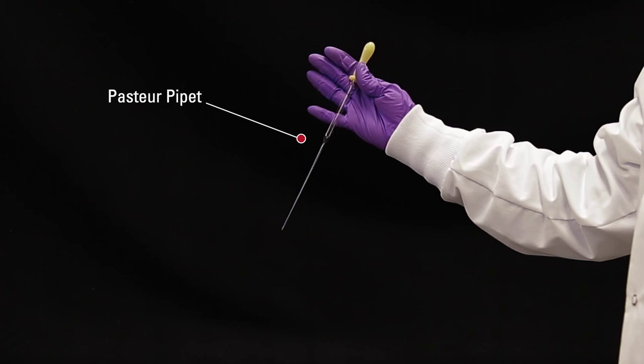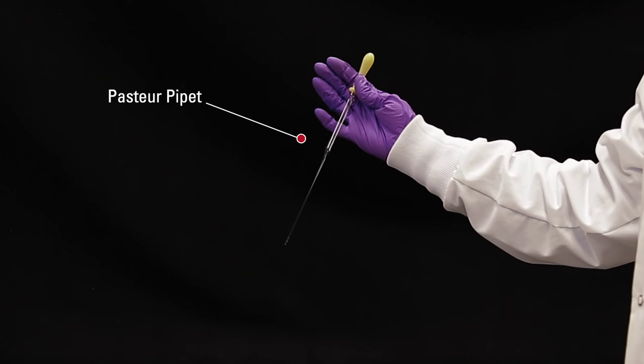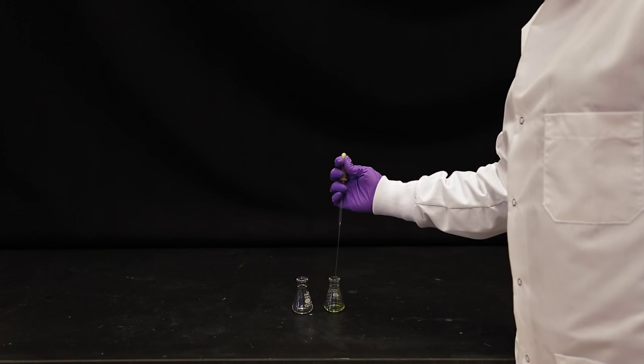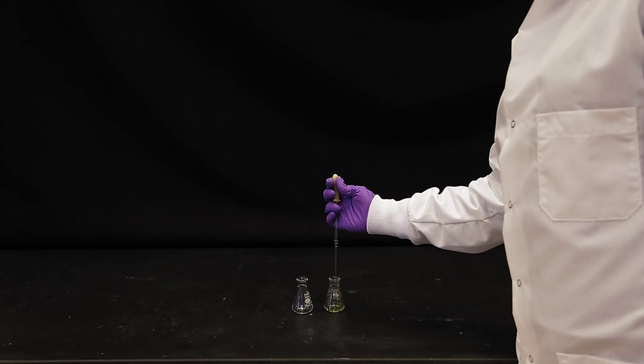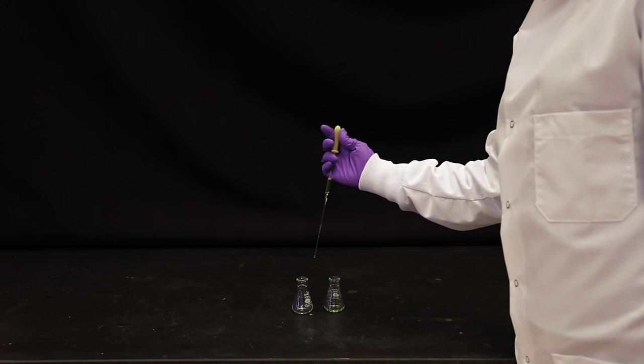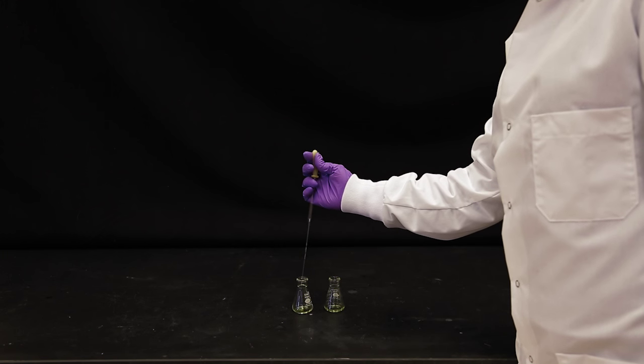This is a Pasteur pipette. Pasteur pipettes are used for dispensing small quantities of liquids, but they can also be used as filtration tools when working with microscale amounts.